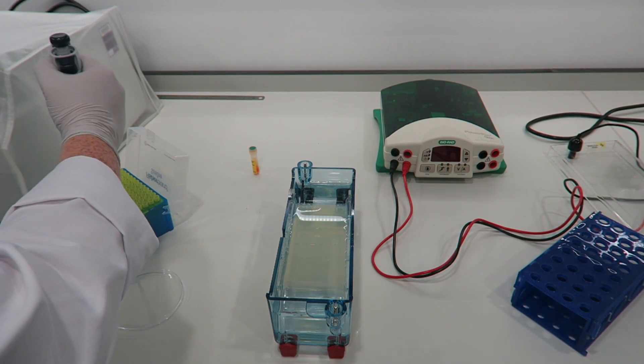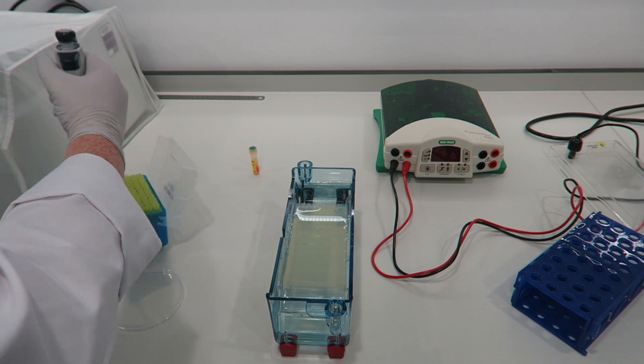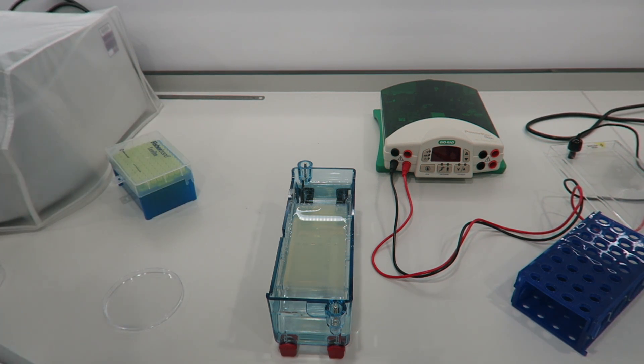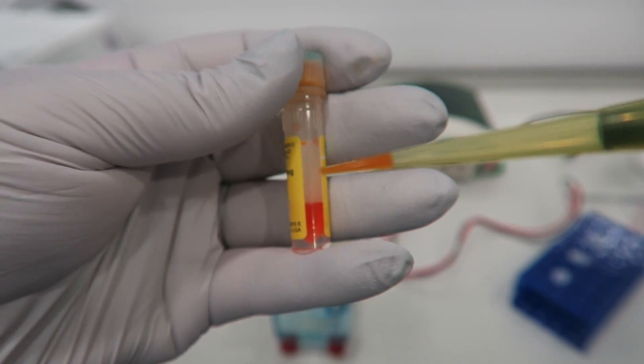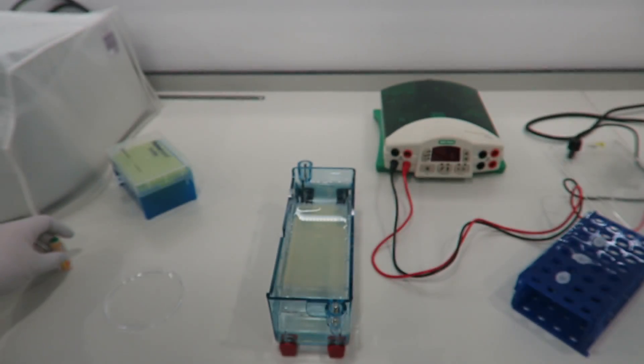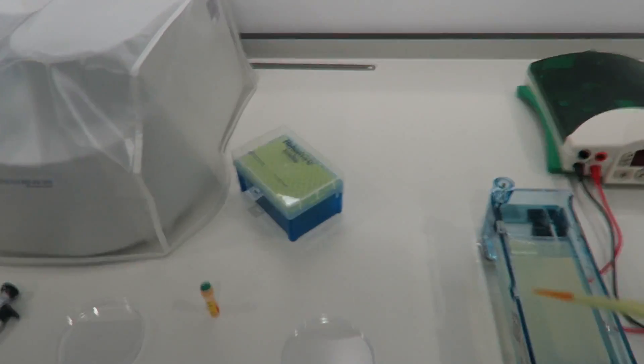Picking up a tip. You want to be careful when you do this so it's not too vigorous. And this is our loading buffer. This is a bright orange dye which will help us see what we're doing.